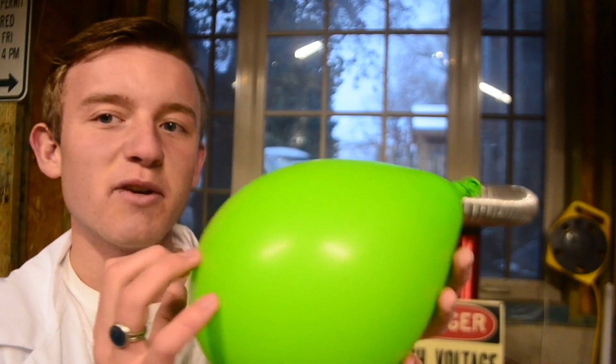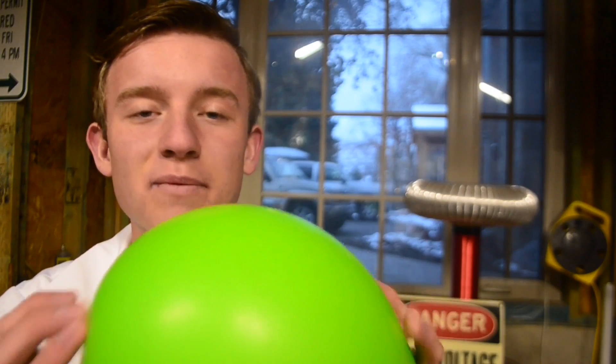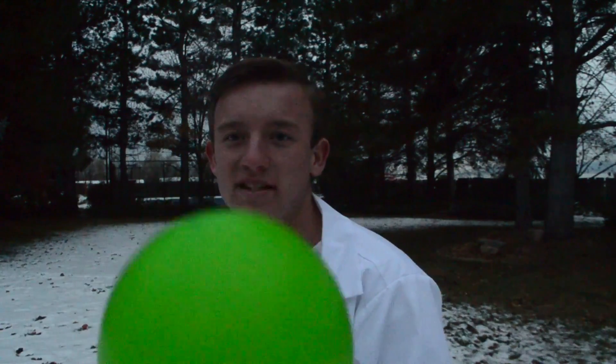Okay, so this is the balloon I ended up with. I think it could have gotten a lot more full than this, but I stopped it a bit early. Hydrogen actually has more lifting power than helium, so you'd expect it to be floating right now. However, since I only have this much hydrogen compared to the weight of the balloon, it's still sinking. Another property that hydrogen has is that it's extremely combustible with oxygen. So I have this torch I made to set it off — I'm going to set the balloon in the snow over here, and then we'll light it and see what happens.